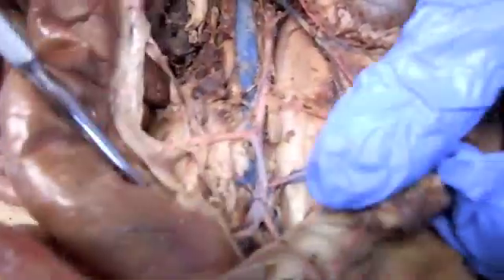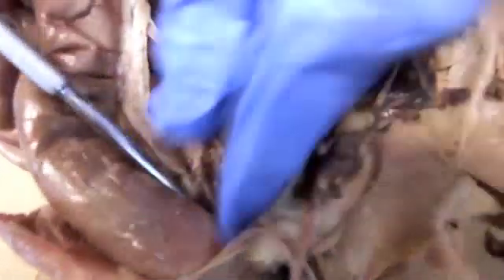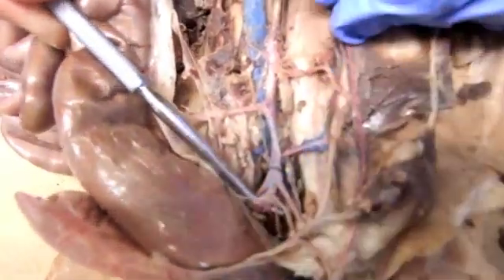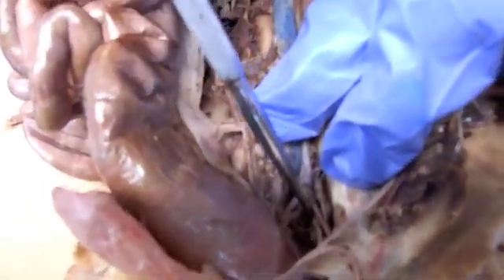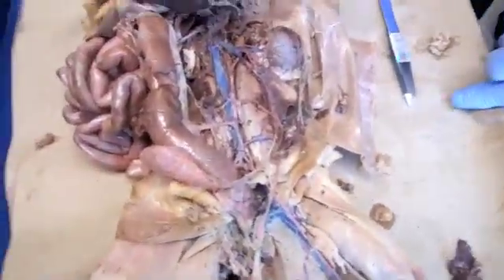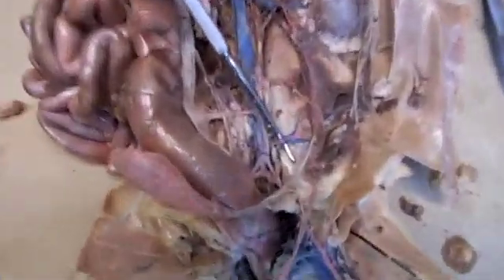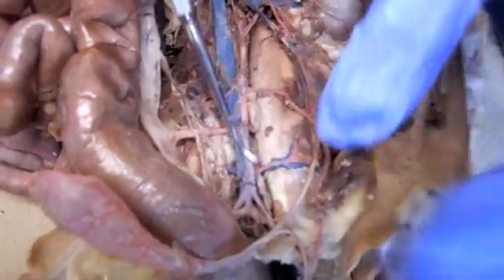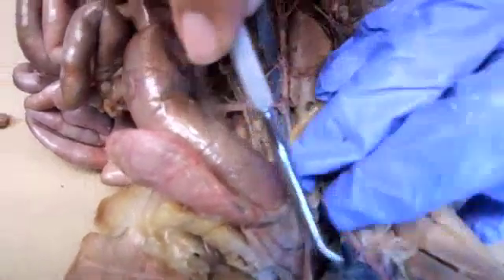Going down here, that's your inferior mesenteric, which comes down into the iliac. You have your external iliac, your internal iliac, and way down in there — that red one right there — the artery that's the caudal artery or sacral. Then ilio-lumbar right here, and then the deep femoral right here.